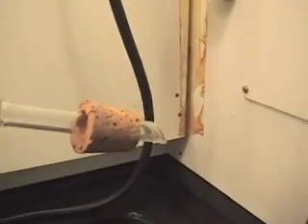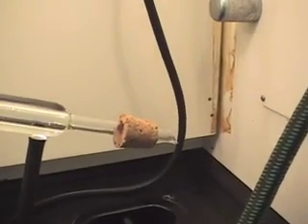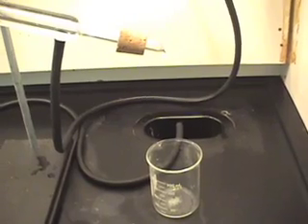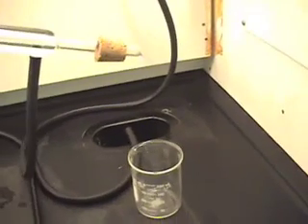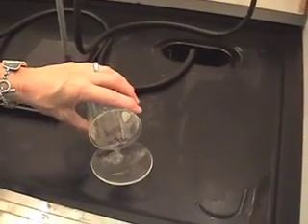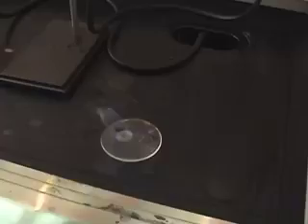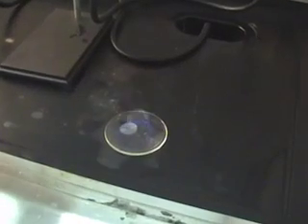The thermometer is measuring the temperature of the vapor right where it comes out. After a little while, I can start seeing some liquid coming out. It's a clear colorless liquid, so it cannot possibly be food coloring because it has a different physical property — color. When I measure the temperature of this vapor, I can see it's at 77 degrees Celsius. That liquid is probably not water because water boils at 100, not at 77 under normal conditions. I can confirm it's not water simply by lighting it — and you can see it is burning. Distillation did not change the composition at all; all it did was separate it.